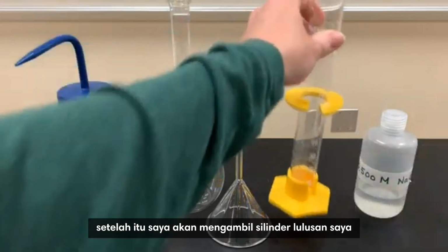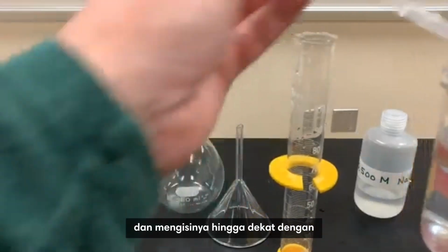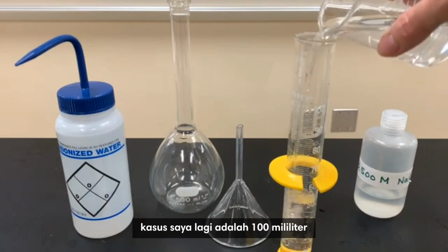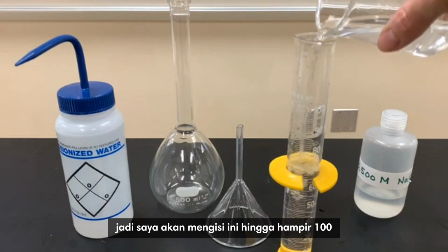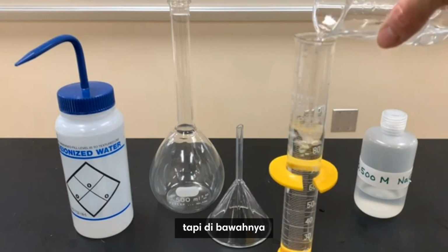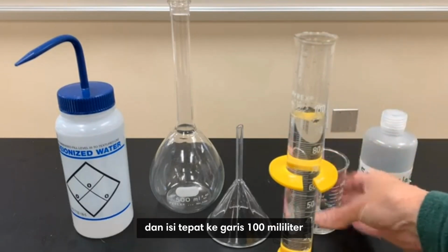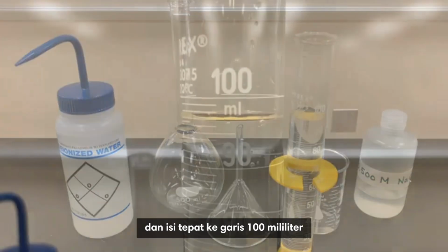After that, I'll be grabbing my grad cylinder and filling it to close to the line that I'm looking for. In my case, again, it's 100 milliliters. So I'll be filling this to close to 100, but below it, so that I can get the grad cylinder at eye level and fill it exactly to the 100 milliliter line.